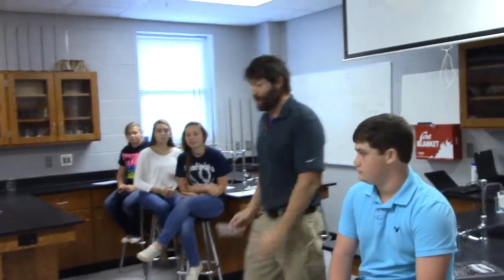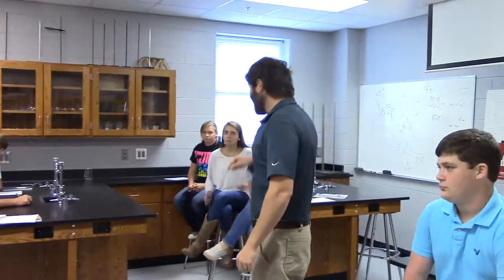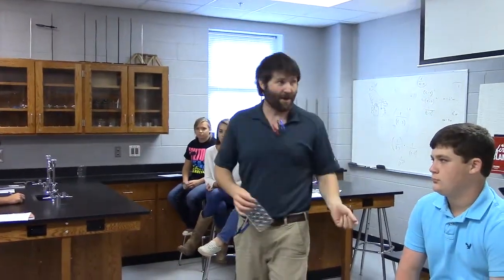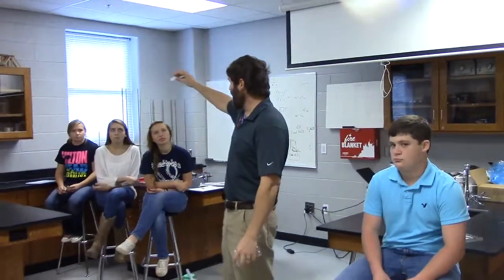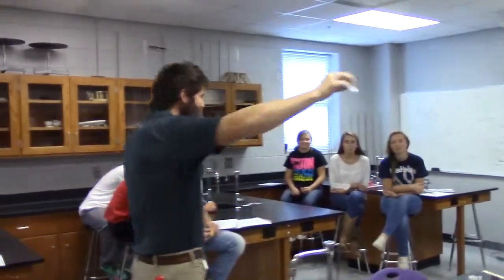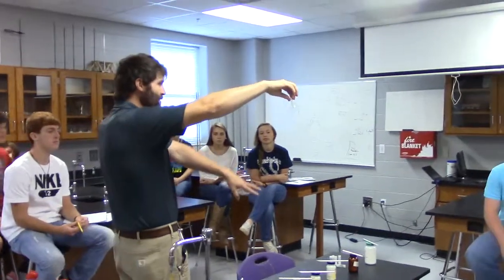So what I want you to do tomorrow in lab is basically what? Burn each one of these chemicals, write down what color it gives off, and then what I want you to do is this. I want you to grab one of these vials. And in this vial is an unknown chemical. So, guess what you're supposed to do tomorrow? You're going to burn these 7.